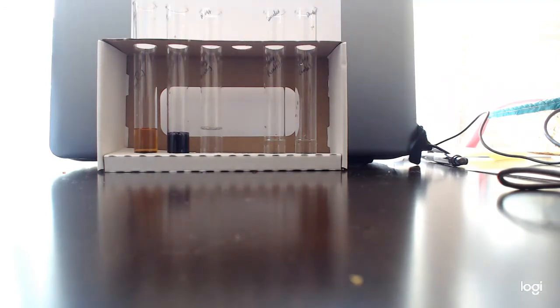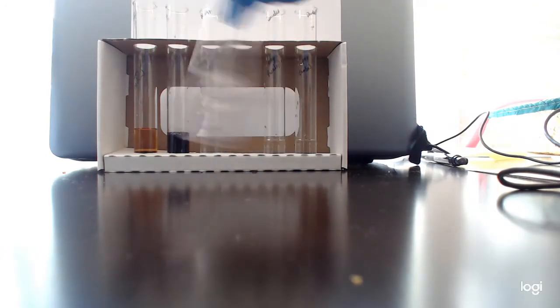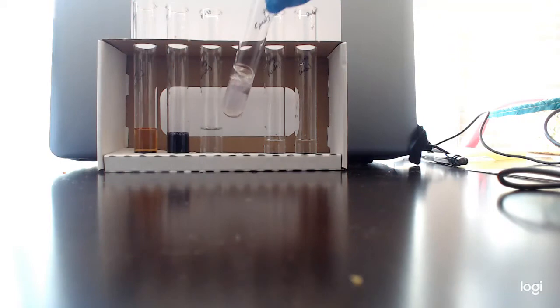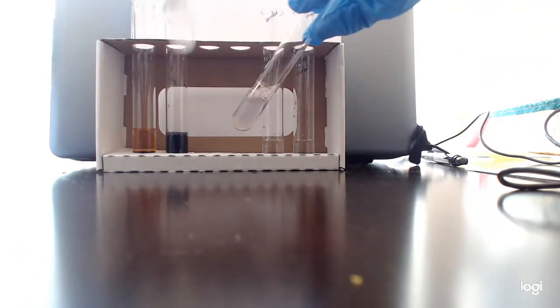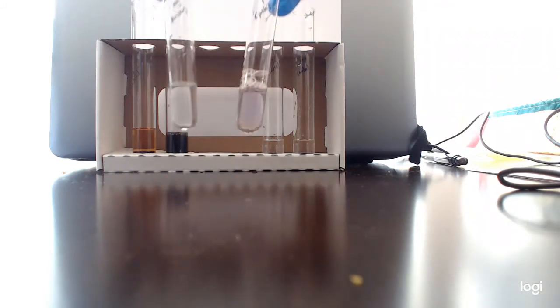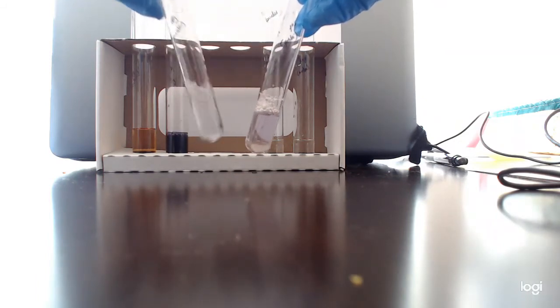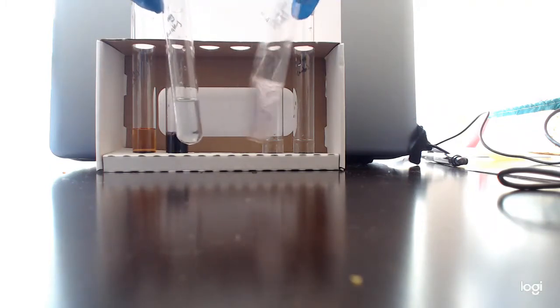Okay. All right. I'm going to swirl this around a bit to let the chemical reaction take place. Kind of gross. But if you take a look, it's turned kind of a purple color. Purple or lavender or lilac or some other version of light purple. And again, this positive purple color versus our negative light blue or clear color tells us our negative and positive controls for protein. This Biuret solution, which is the original blue solution that I used, remains clear or light blue in the absence of protein, but turns a light purple, lilac, periwinkle lavender shade if protein is present, like in our protein solution.